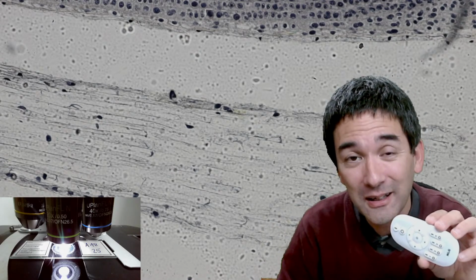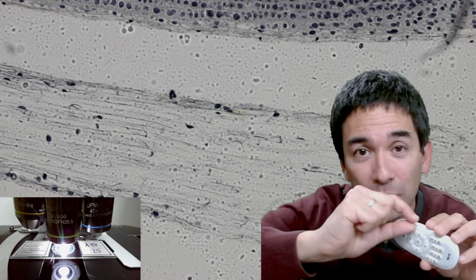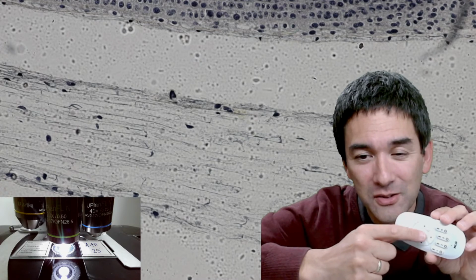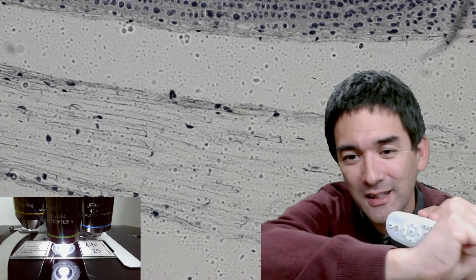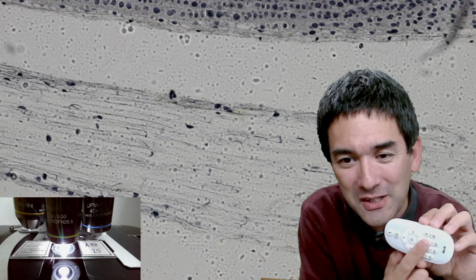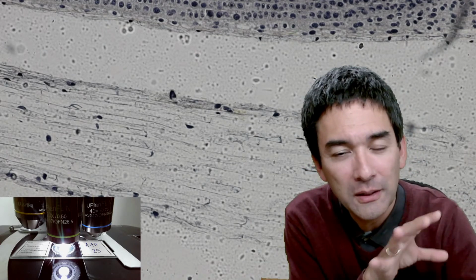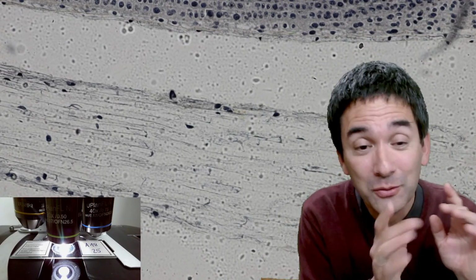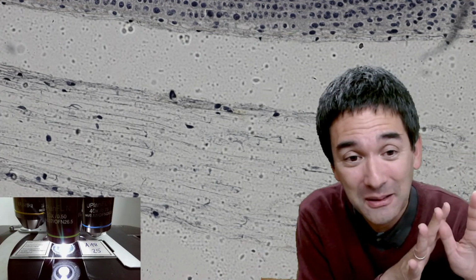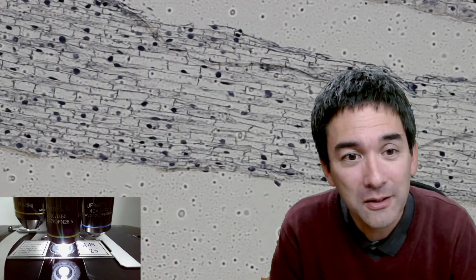It actually means that the section is so thin that I've removed or cut away the nucleus. Again, if this circle here is supposed to be the nucleus of the cell, and I'm just looking at a section that goes across like this, then I'm of course not able to see it. When interpreting microscopic images, you have to be a little bit aware, because you might think, oh, I found a cell without a nucleus, but in reality it does have a nucleus, you just don't see it because, by the preparation of the slide, it disappeared.